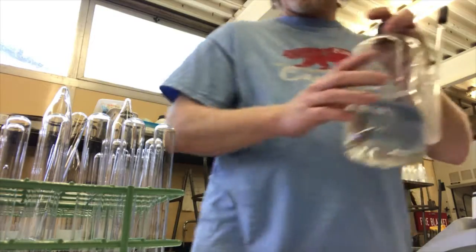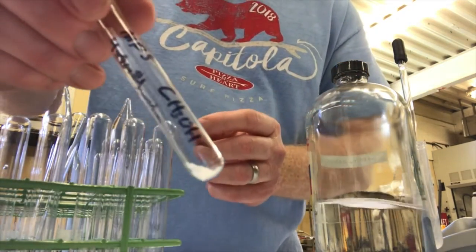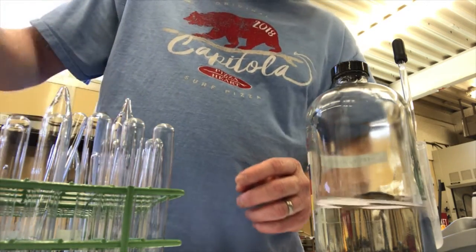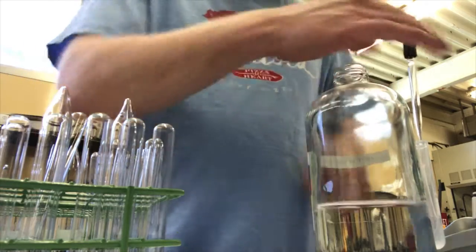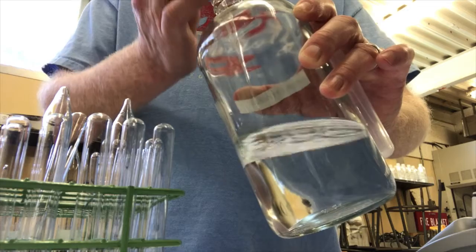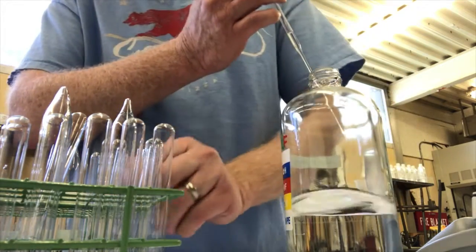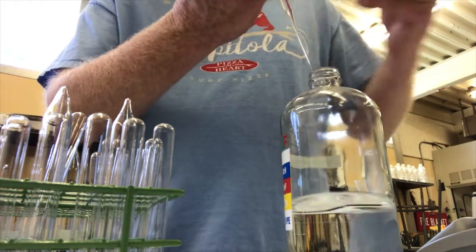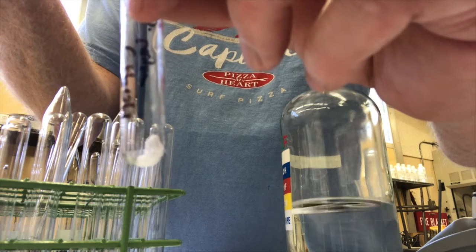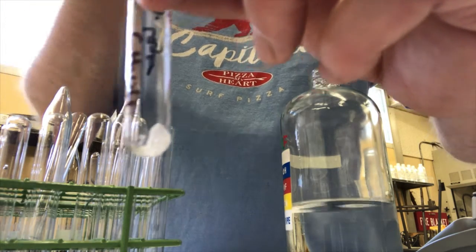So I get the methanol bottle and my methanol test tube. Make sure it says methanol. It does. This is the methanol test tube. And open the cap. Draw up some of this methanol. Push it back out. Draw some up. Push it out. Okay, that's probably good. And now here's my methanol. Drip in some: 1, 2, 3, 4, 5, 6, 7, 8, 9, 10.